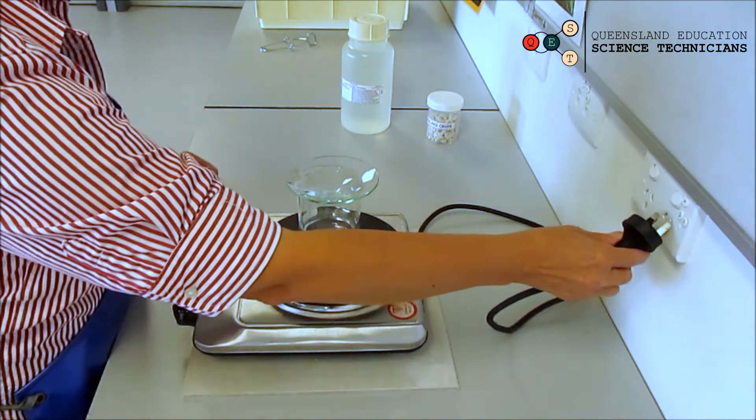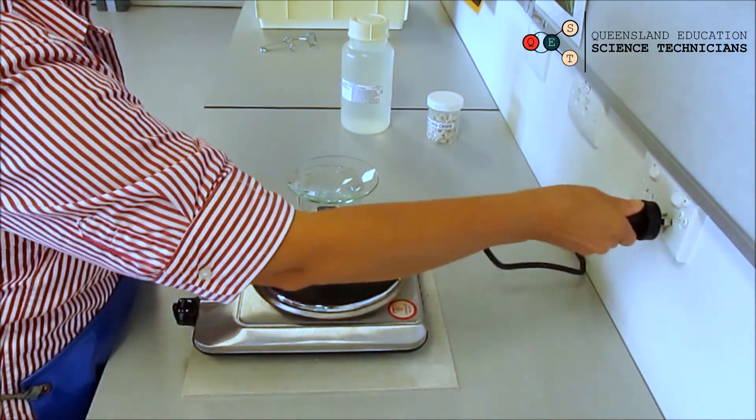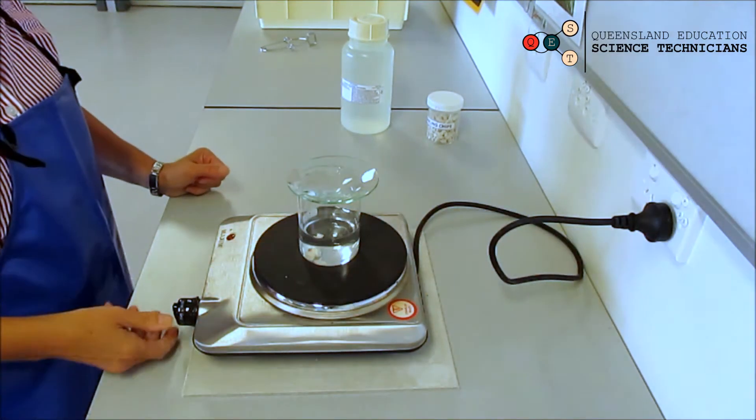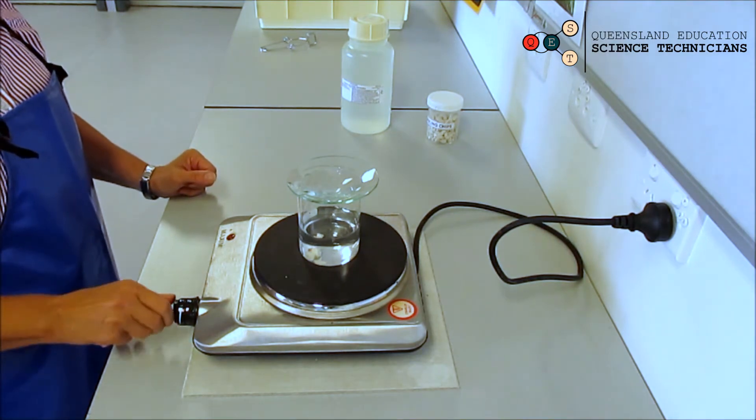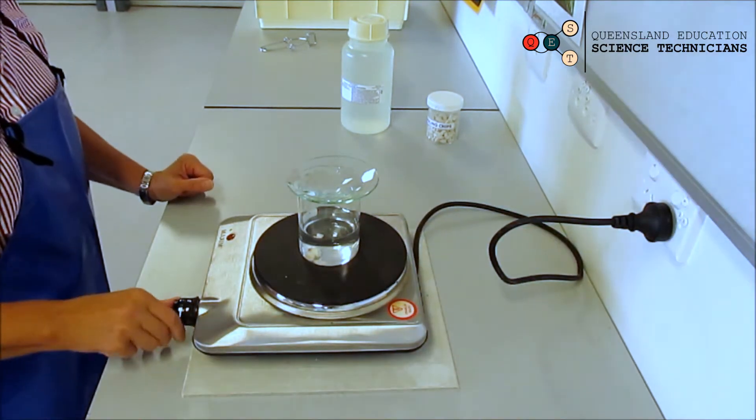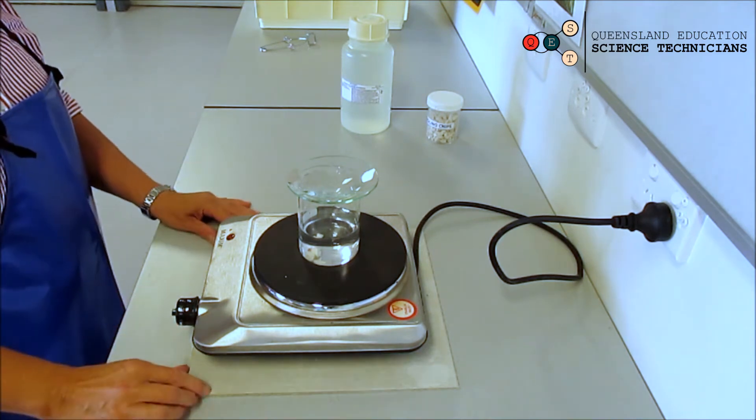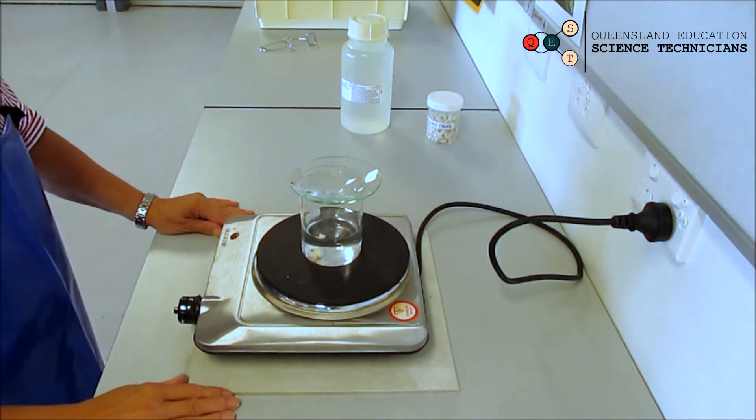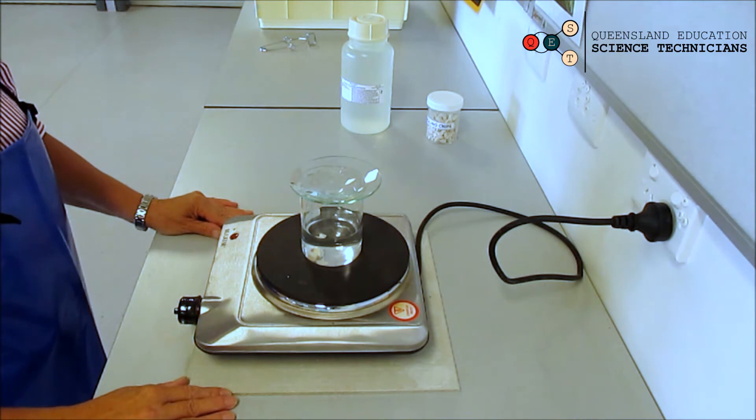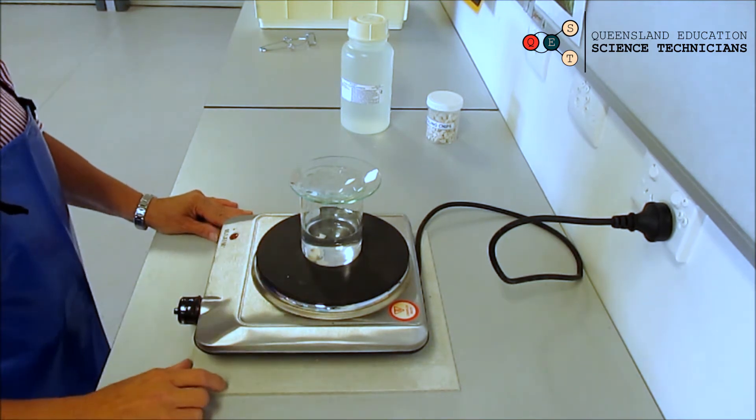Then you can plug it in, turn it on, and it will take a while. That's why starting with hot water or warm water is better, because that'll take a while to start boiling, and you just need to keep an eye on it for safety reasons.